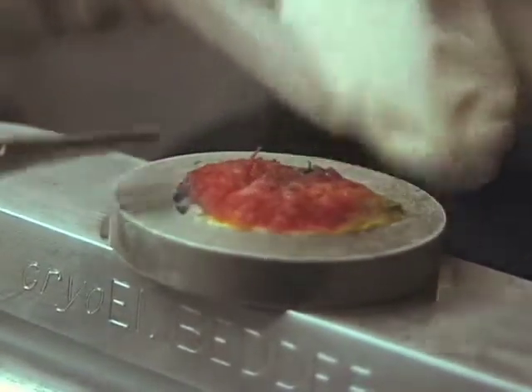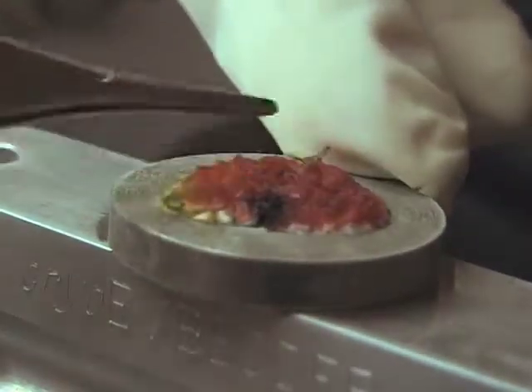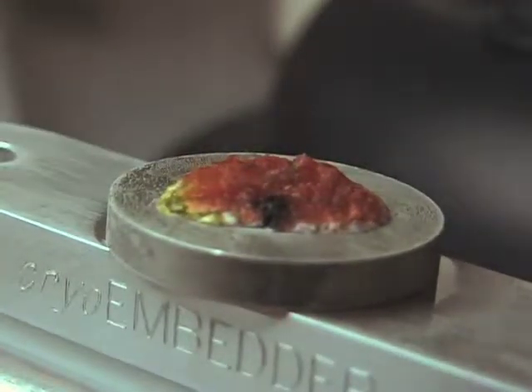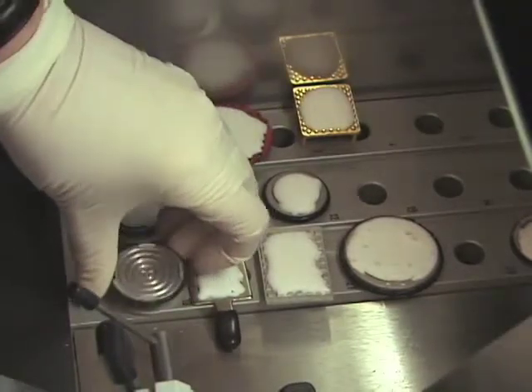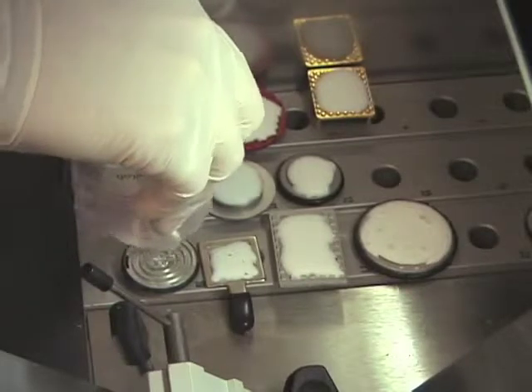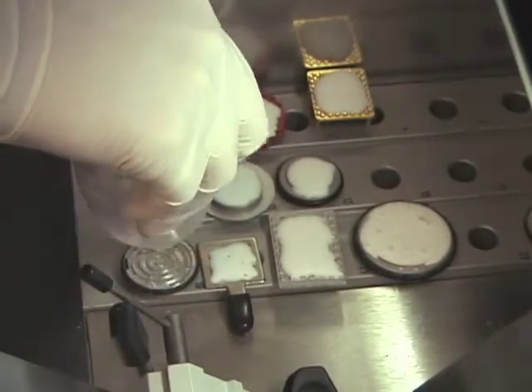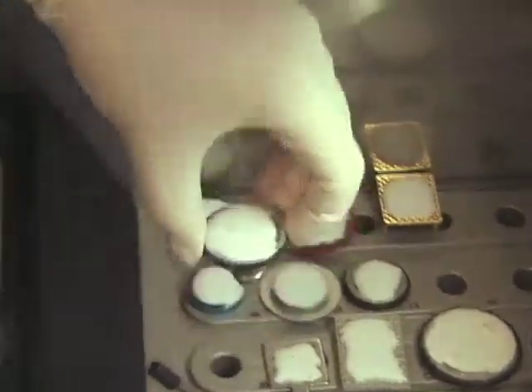The tissue is now frozen securely onto the disc. Be sure to tap the top of the specimen so the center will attach to the disc. You can now visibly verify that the specimen is frozen on a flat plane. Cutting chucks should be prepared with embedding medium while they are warm so the medium can fill in the grooves for gripping power.